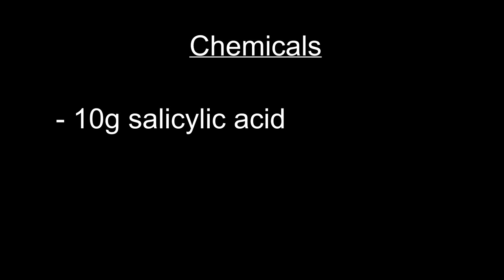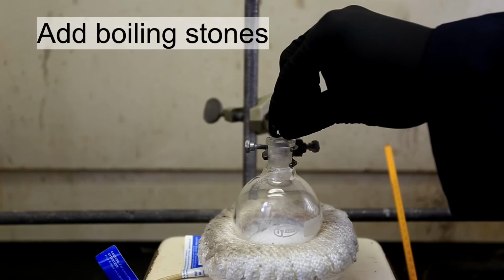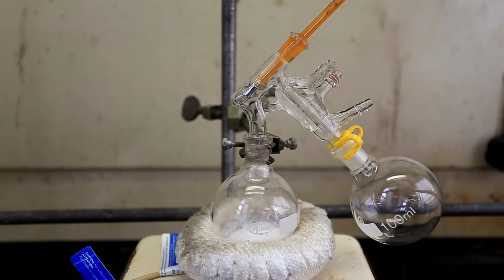For this experiment, only one chemical is required, and I used 10 grams of salicylic acid. A 100 milliliter round bottom flask was charged with 10 grams of salicylic acid, and then some boiling stones were added. A short path distillation apparatus was then set up. You can likely use a regular distillation apparatus, but you'll just have to insulate it really well.